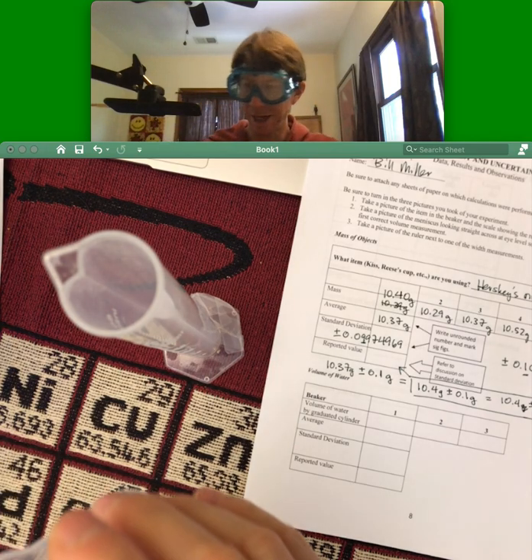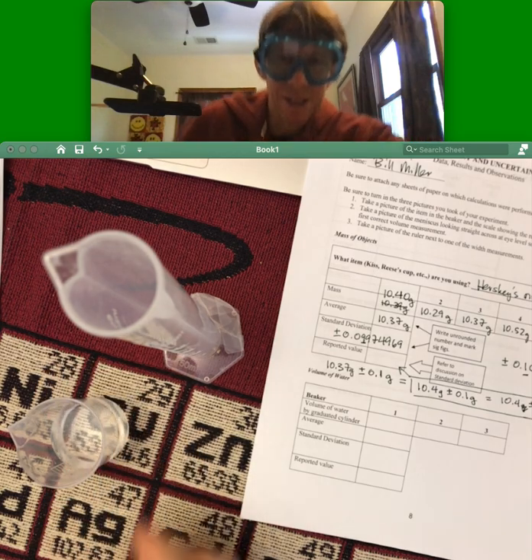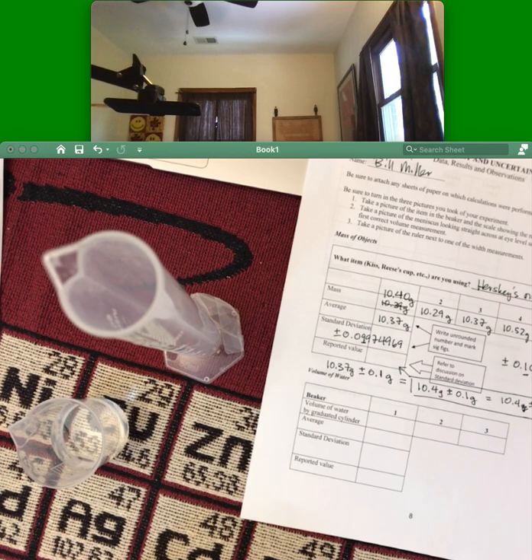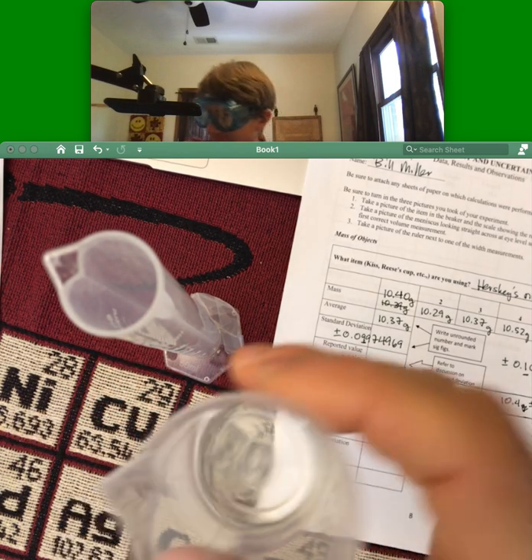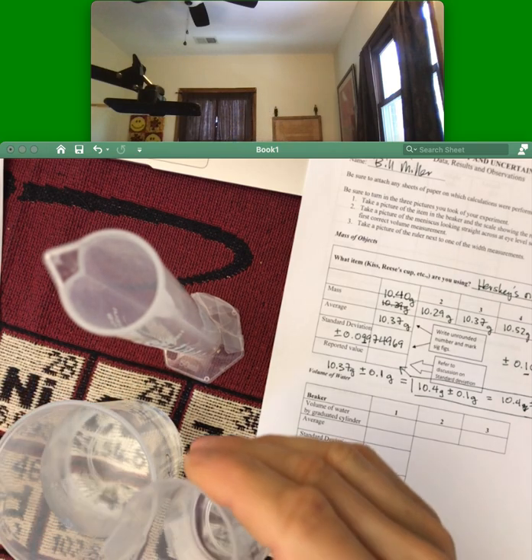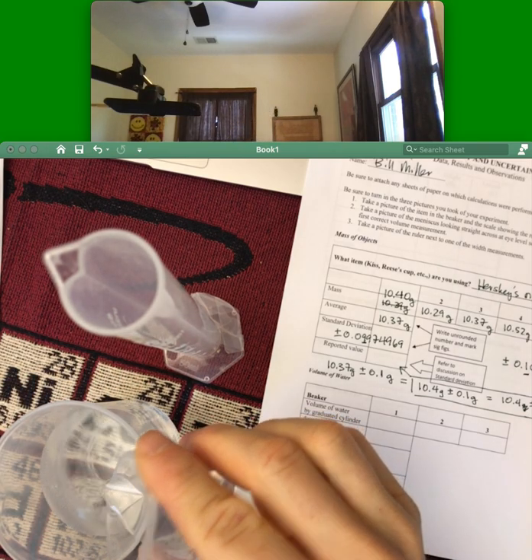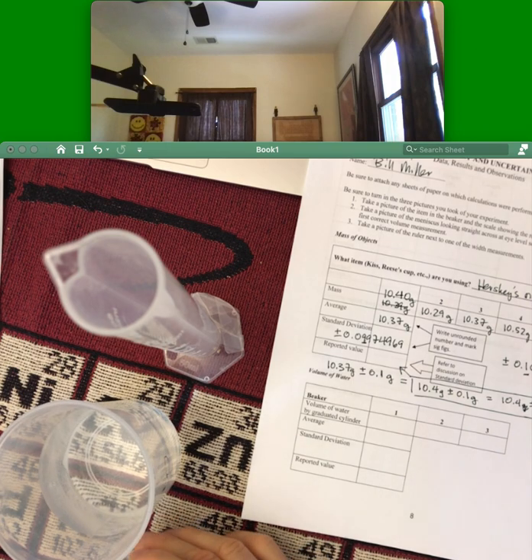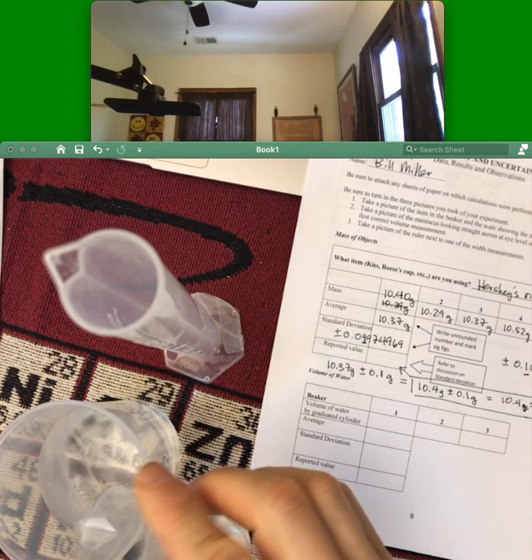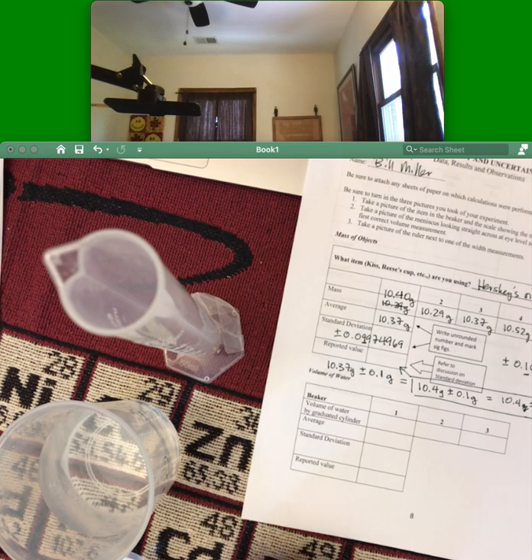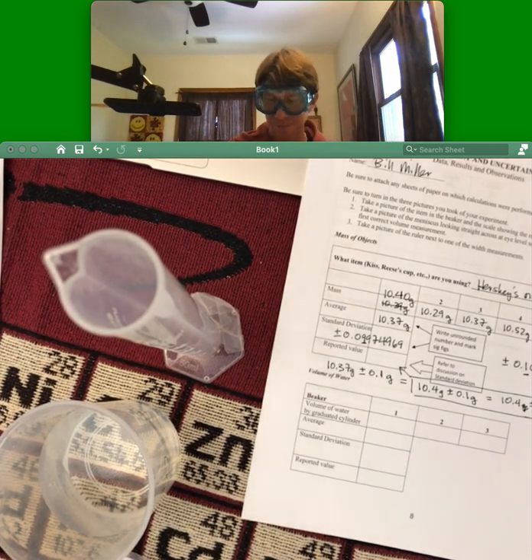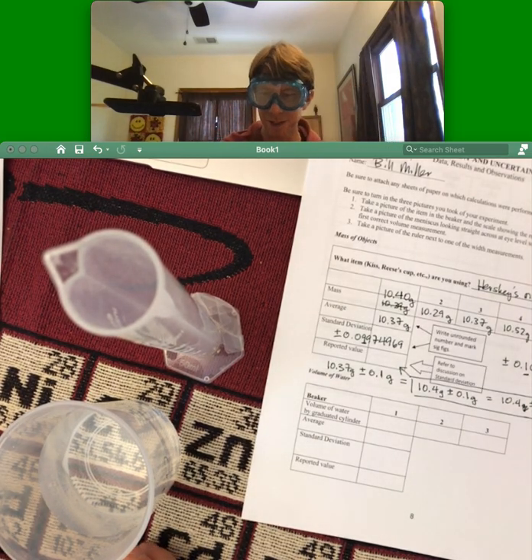I am looking straight across. In fact, what I am going to do is I am going to get down and make sure I am looking straight across. Ooh, wow, I am off. So I am going to pour it back in because it wasn't level, I guess. Hold on, where is the 25? Still too high. Alright, now the meniscus is pretty flat there. I can see that the bottom of the meniscus is on that 25 line.